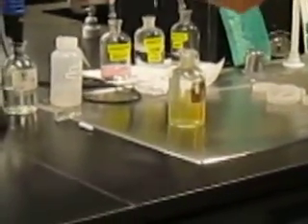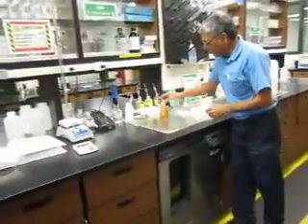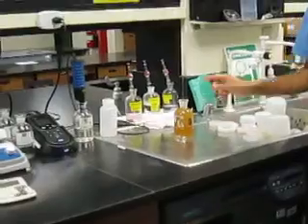I'll just let it sit until it settles halfway. It's not working because there is no space for it — let me add some clean water. We'll wait until it settles halfway, then put acid in it and dissolve it again. Then I'll take 97 ml out of this, leaving 203 ml inside, because this bottle contains 300 ml of water.